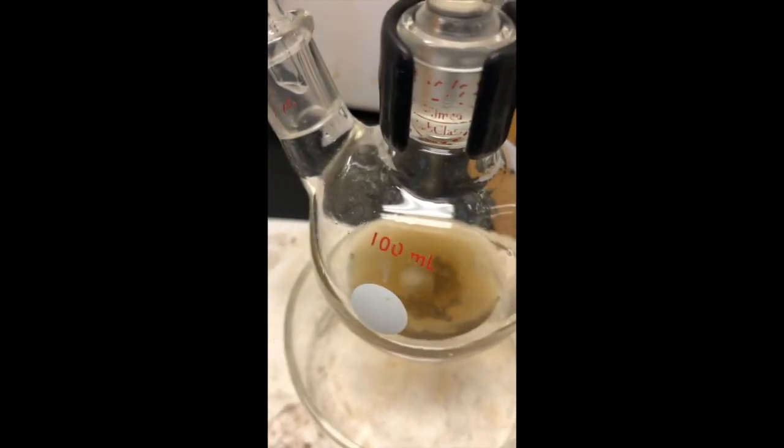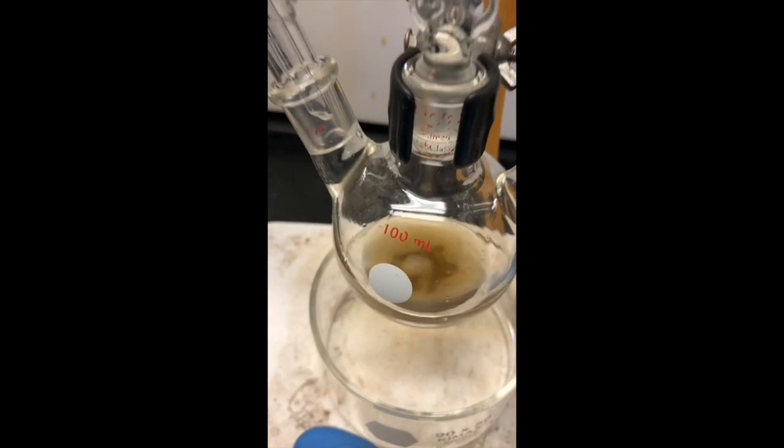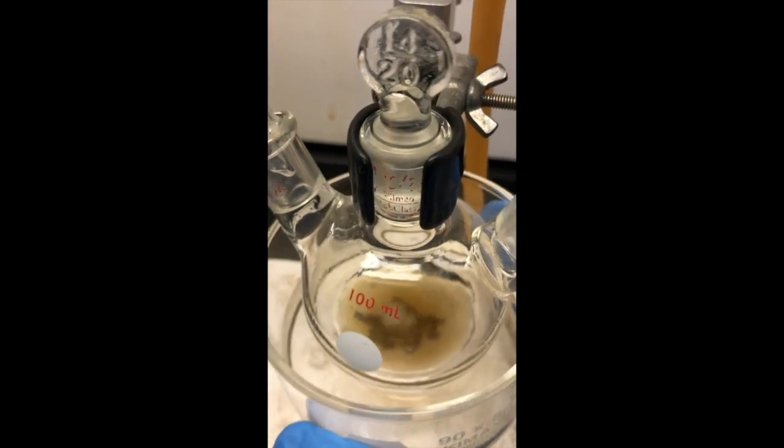The reaction is quite exothermic, and we have lots of bubbles coming off, and we can, of course, bring our warm water bath up and boil it even faster.